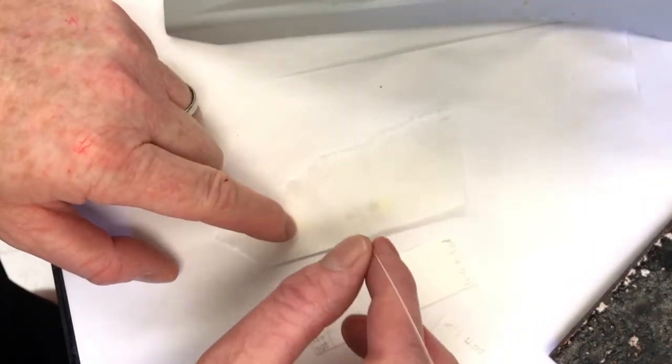Spot most of that out. And now where it says 25 seconds, it's not 25 seconds. I'll tell you what it is when I spot it. So I could have just left these blank. Okay. Boom. That was at minute 35. So 1 minute 36 seconds. Okay, next up.